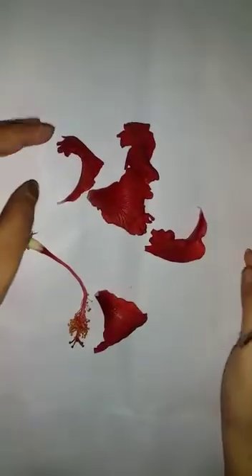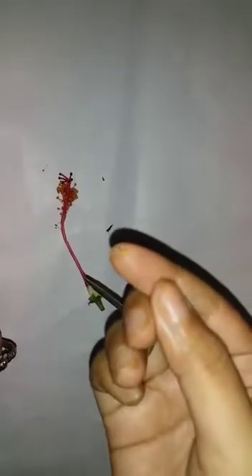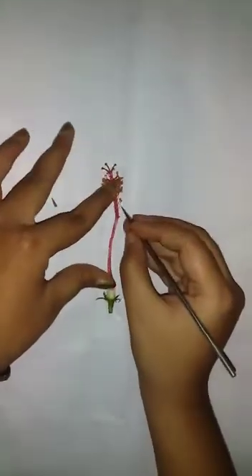This is called the staminal column. There are numerous stamens here. Look closely — the anthers are kidney or bean-shaped. This is a distinct character of the family Malvaceae. Now separate the staminal column to see the gynoecium.